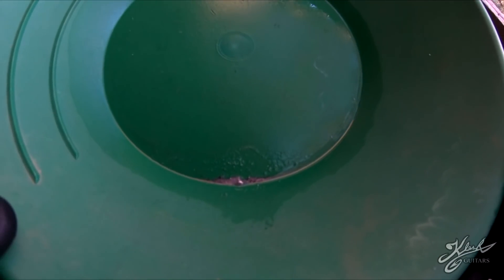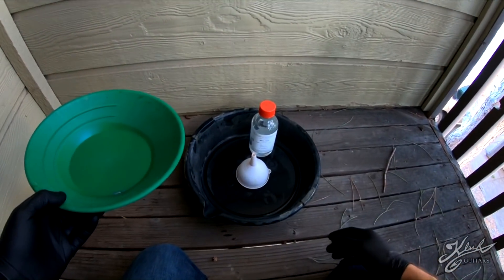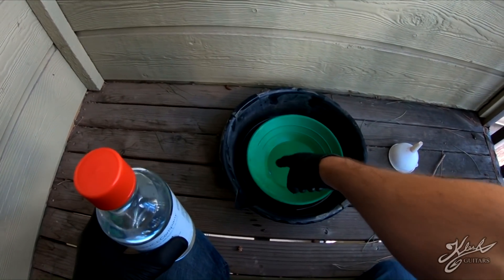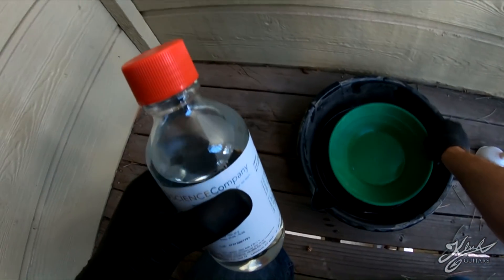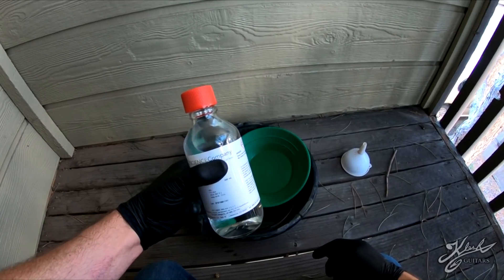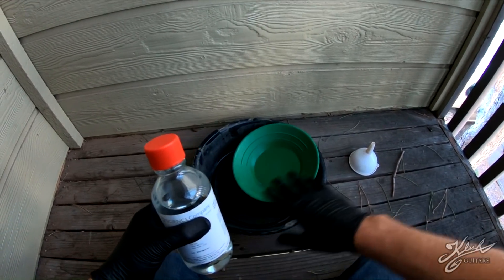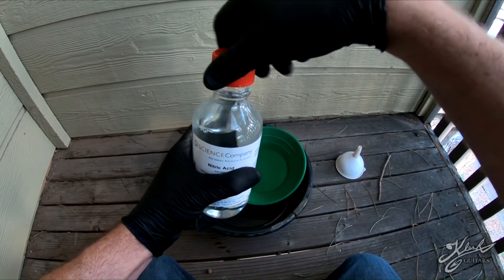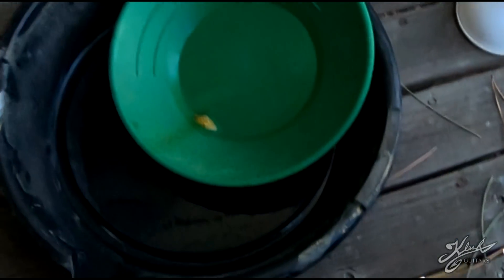Just for comparison to see how much gold we get after we're done. Right here I have my little workstation - I'm on the other side of the house away from all the neighbors. I have my safety tub, a gold pan with some mercury-gold amalgam in it, and here I have some nitric acid. I'm going to pour a little bit of nitric acid in there, tilted down so all my gold's at the bottom. We're going to get out of the way and let it go for about 10 minutes or so.